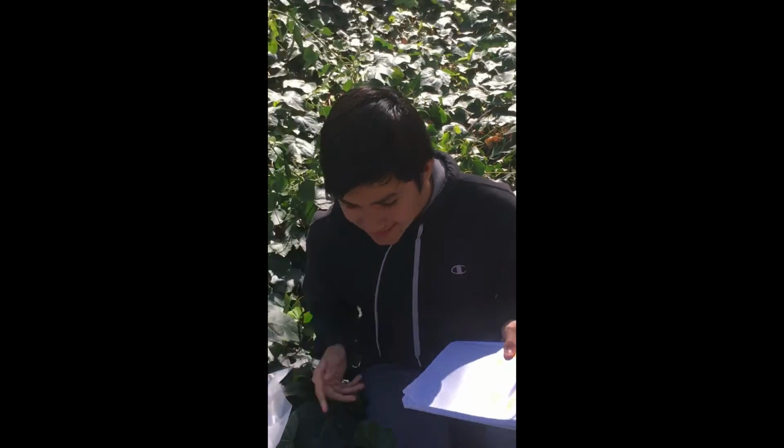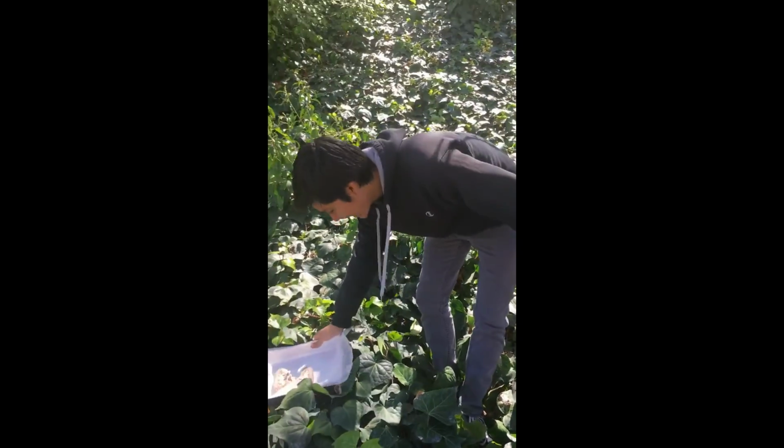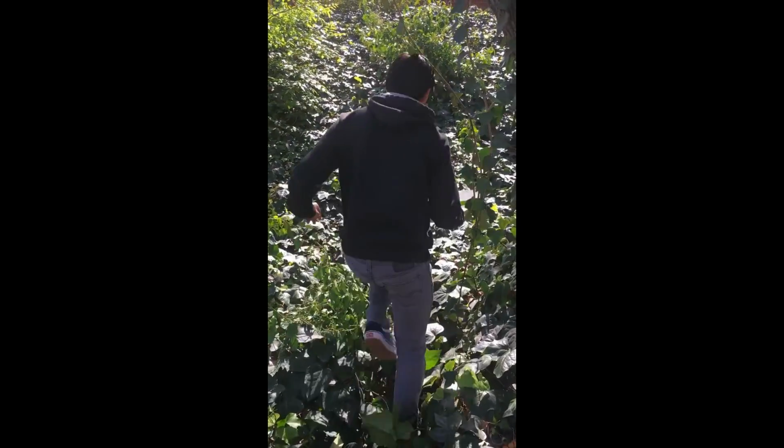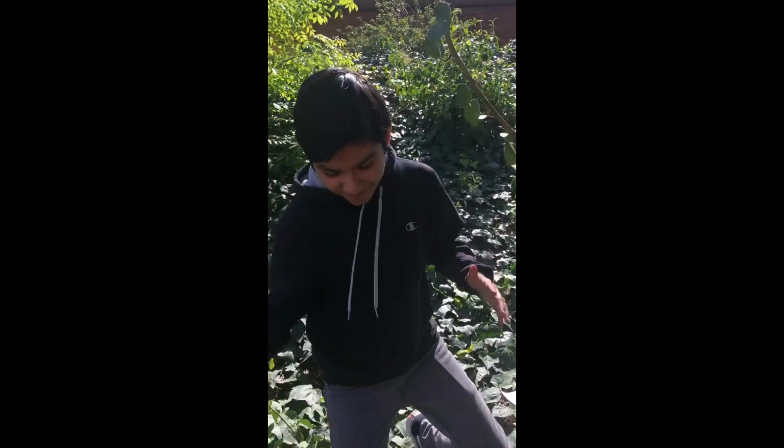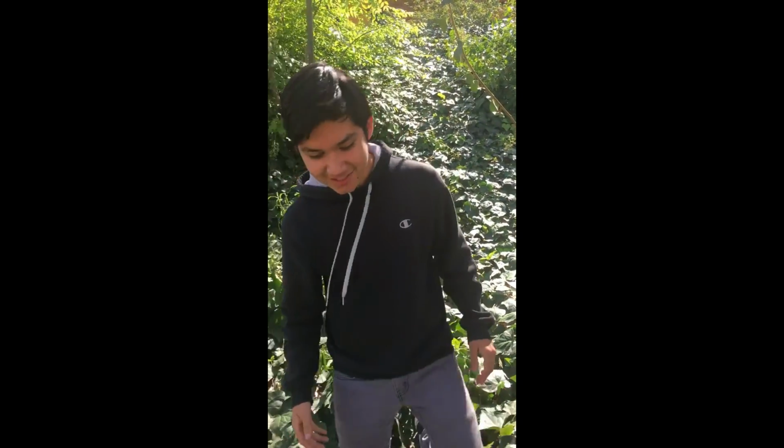Alright, we're gonna put this bad boy back, and hopefully you guys enjoyed that expedition. I cannot believe we actually just found a wild kidney like that. That was crazy.